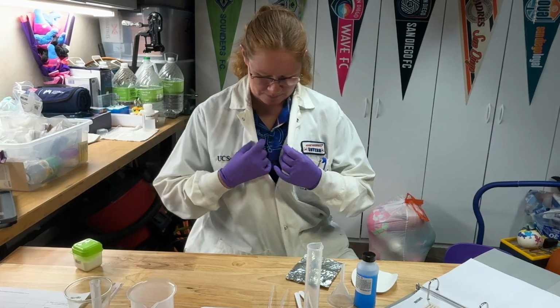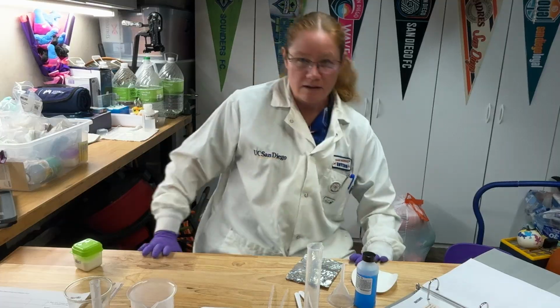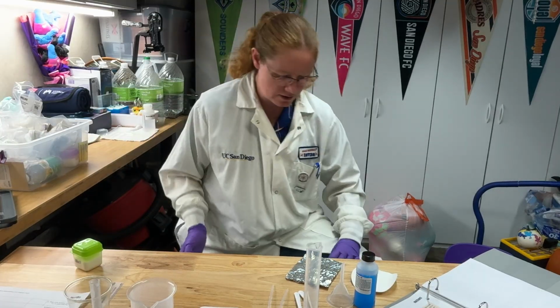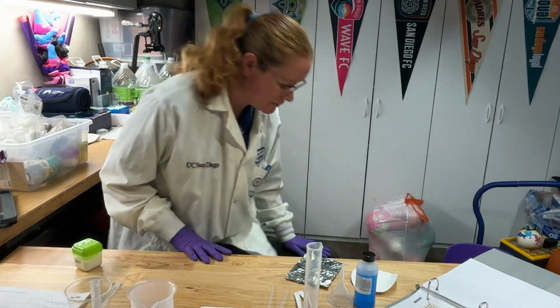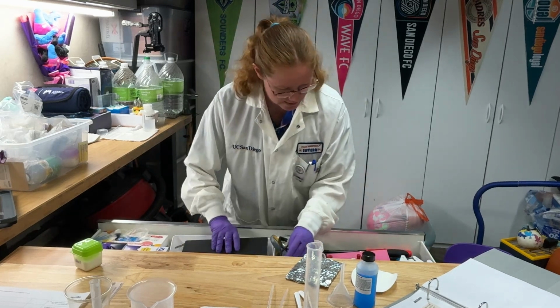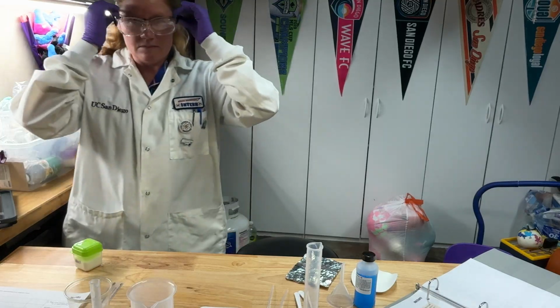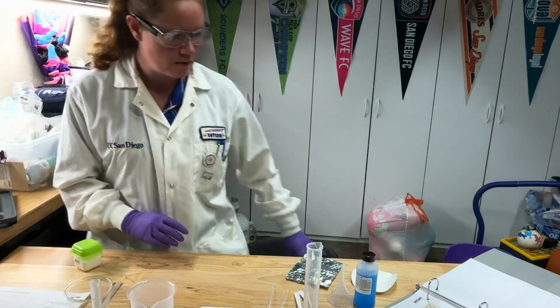So I'm going to make sure my PPE is ready to go. I've got my gloves on, I've got my coat on, you'll have your aprons on. Let me get out my safety glasses, okay? And now I'm ready to go.